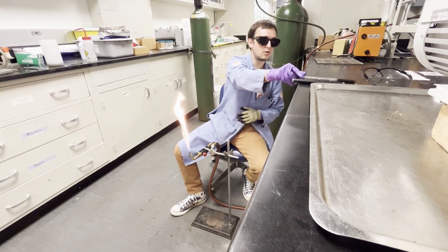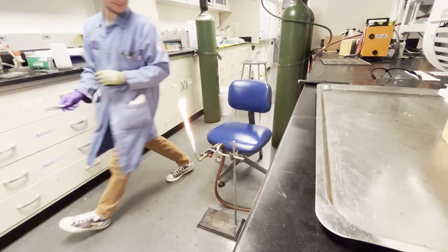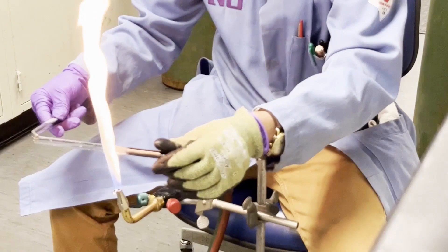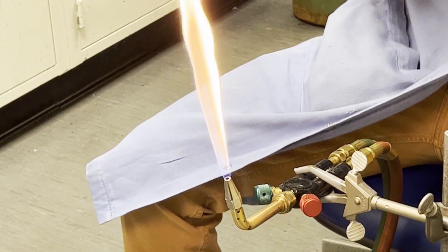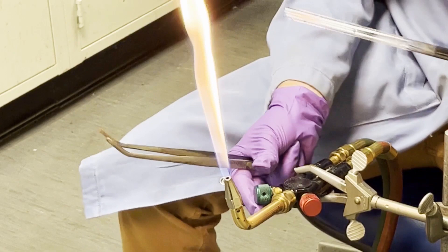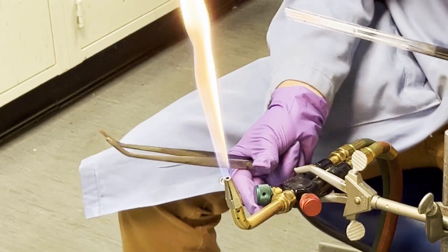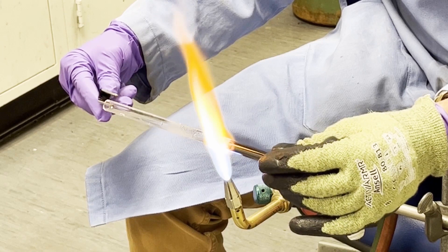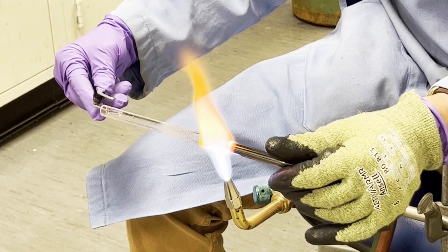All we really have to do is we can walk the flame up the end of the tube. That way we can start to clean off the edge. You're going to hold it in and you're going to see this sort of red bloom again—that's going to be the carbon heating and actually coming off your tube. So now we can see this nice red edge and I can just walk the flame up and down my tube, and we're removing that extra little layer of carbon so that we get nice clean edges.